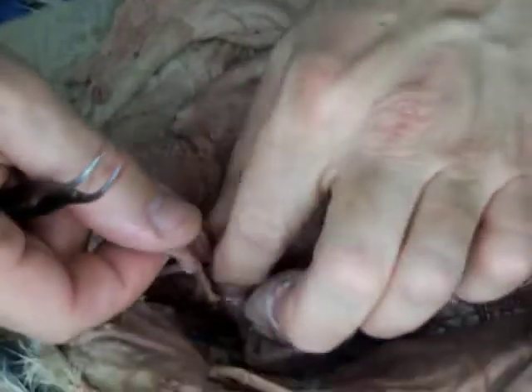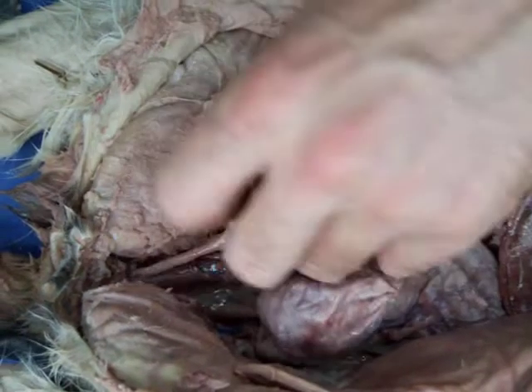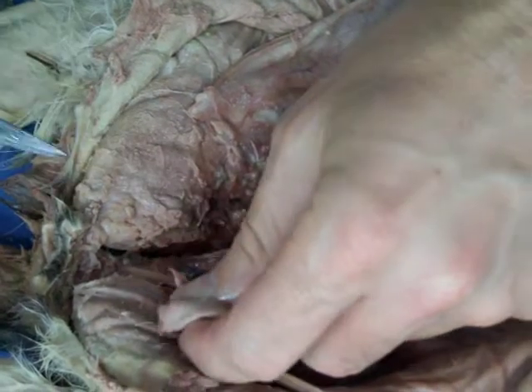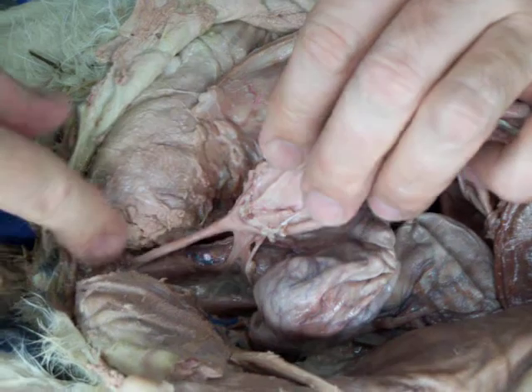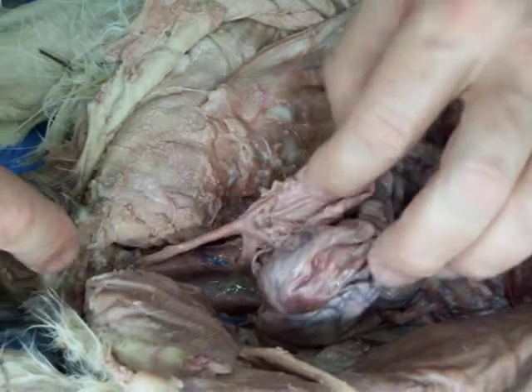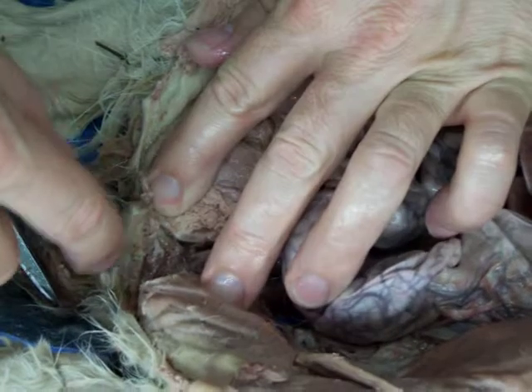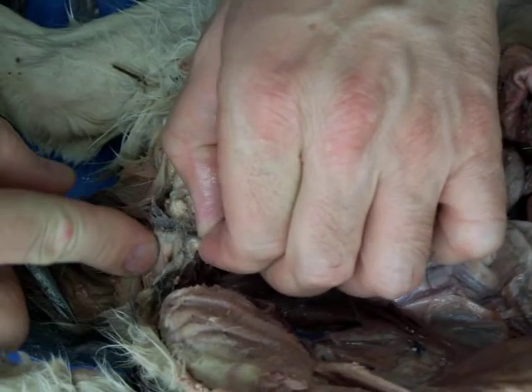Okay, now I think I'm going to kind of liberate the bladder here. So we can pull that off to the side. With the bladder, I've exposed down through the pelvic outlet, and you can see the urethra traveling down. There's a lot of connective tissue in here, so I haven't really cleaned that up much, but I have opened up the vaginal vestibule by cutting the perineum.